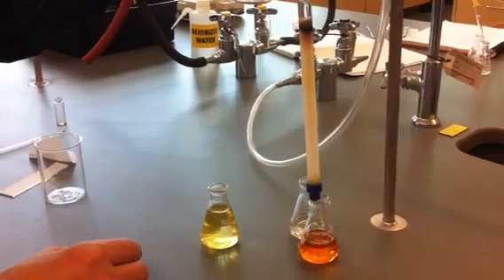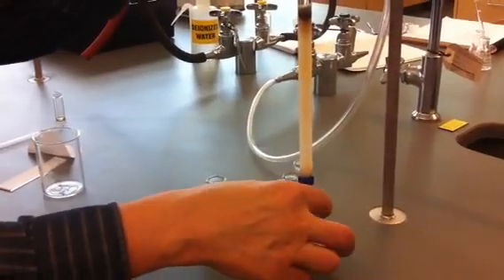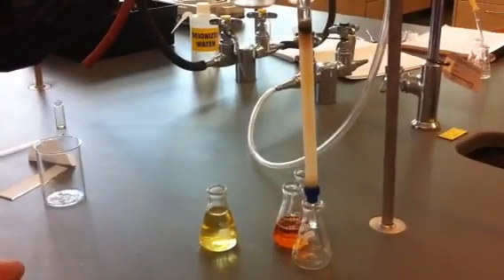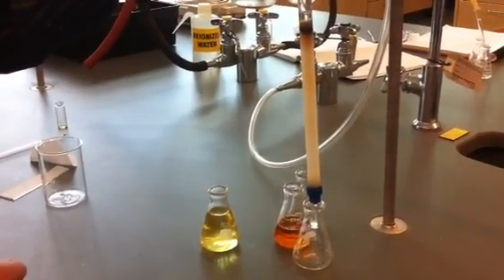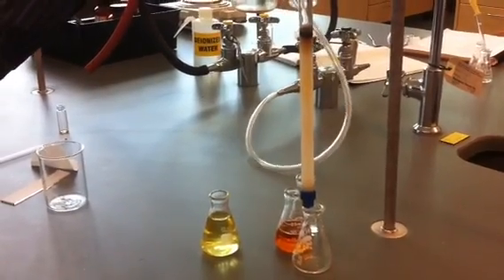No. What do you think? Is that done? Let's see. Looks like it. One more. Look at that. Am I a pro or what?